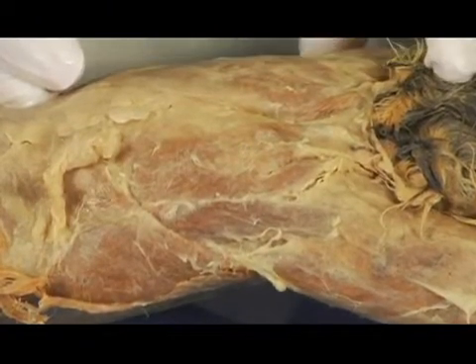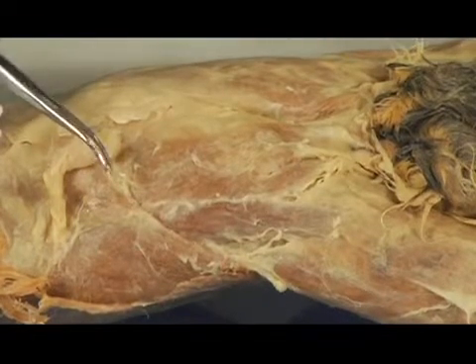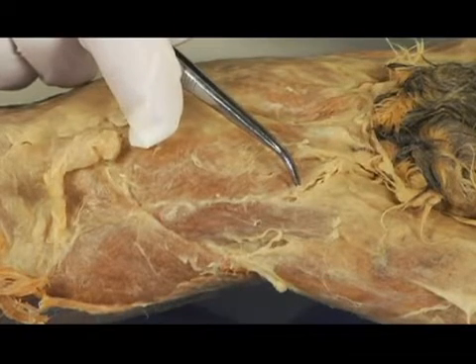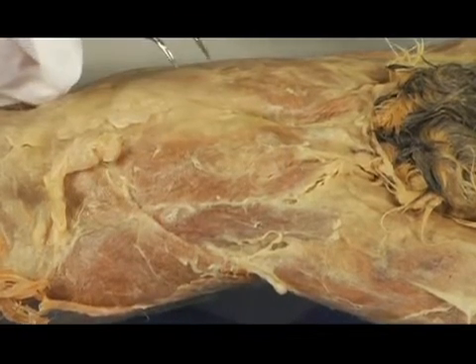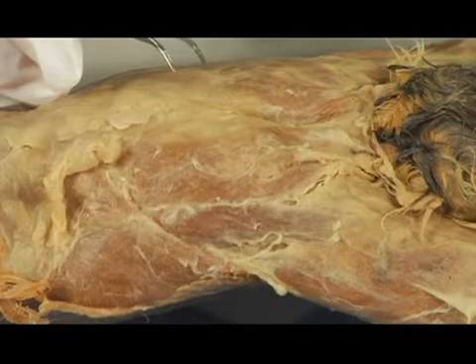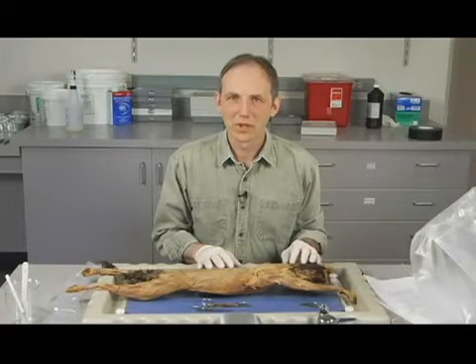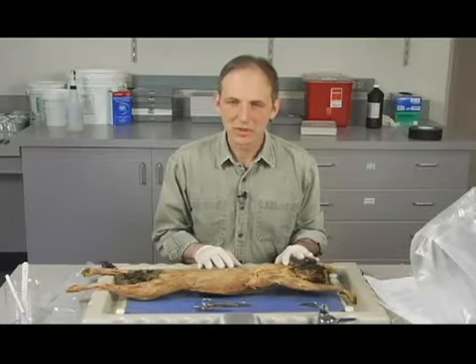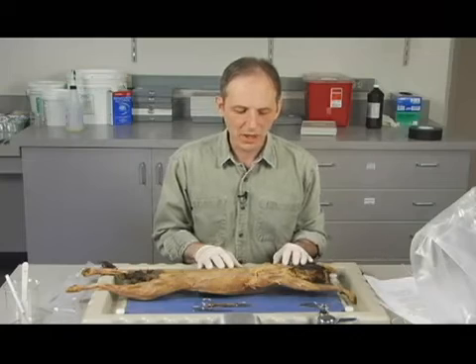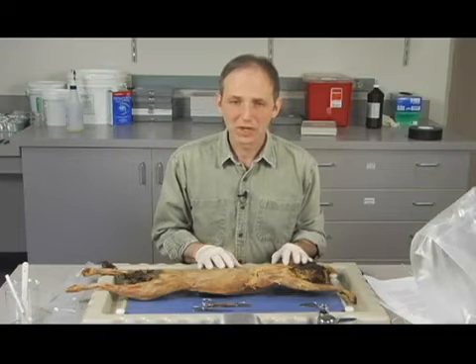And that's basically what you'd be doing throughout the entire surface of the cat, is removing connective tissue, exposing muscles, defining them by separating them from other muscles, and then making your identification. And that's essentially how and what we do with the cats. Well, that's about what we were going to accomplish here today with the demonstration of the dissection. We've kind of worked in the shoulder area here. It took me about 10 minutes or so. It could take you that length or considerably longer.